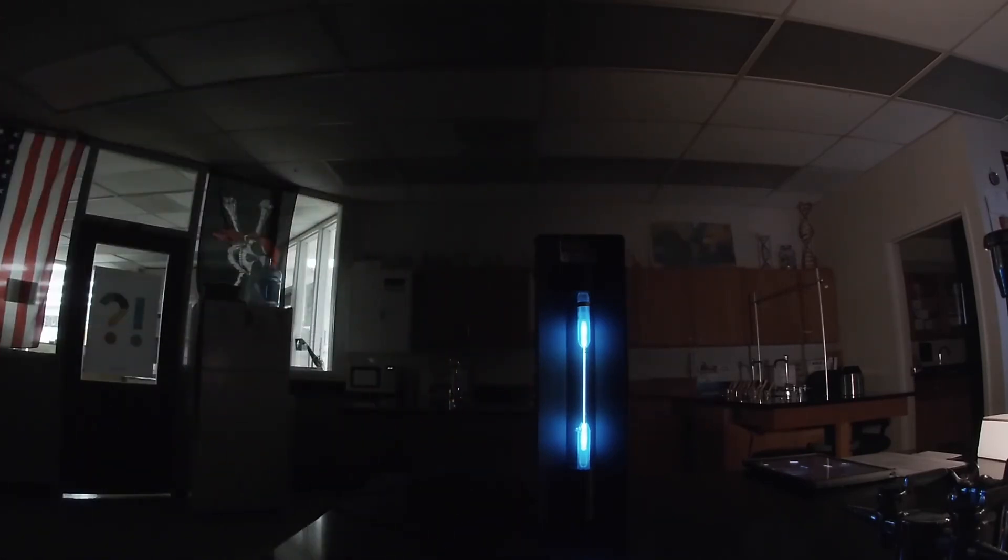By using a diffraction grating—I'm using these spectral glasses as a diffraction grating—I can separate the entire lamp into its component colors. I'm going to put the diffraction grating over the lens of my camera.